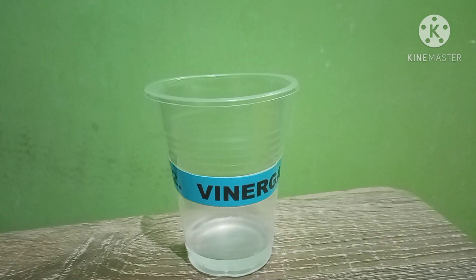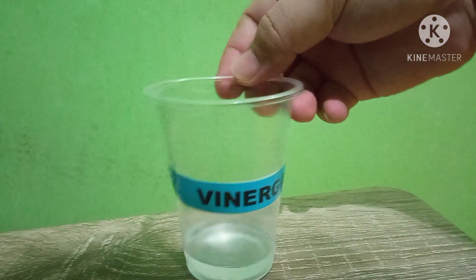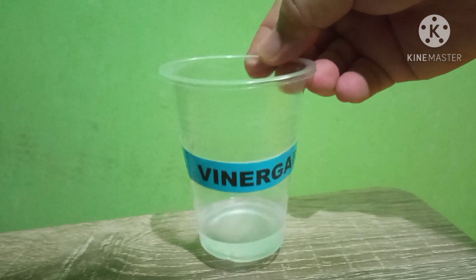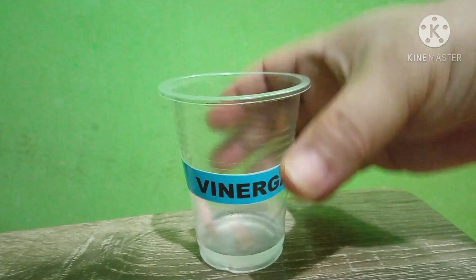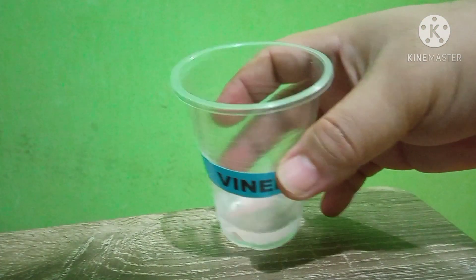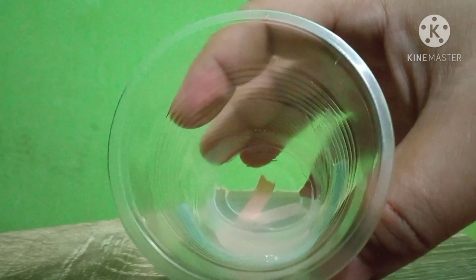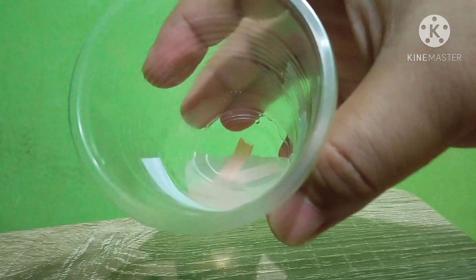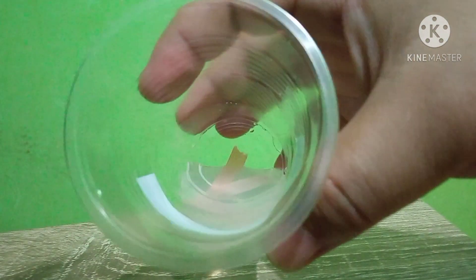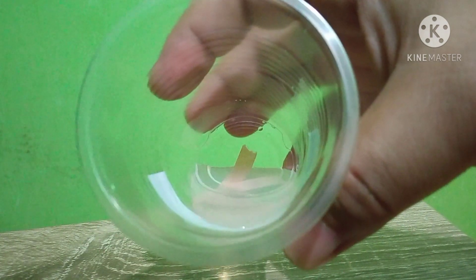Next is Vinegar. Let's place the litmus papers in. Both turned red in vinegar — the blue one turned red. So vinegar is an acid.